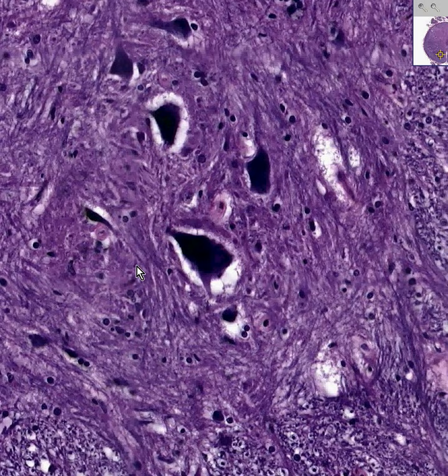Maybe if you see a real small one like there or there, that could very easily be a microglial cell. And a good rule of thumb is that not only are neurons 10 times bigger than astrocytes, but they're about 1/10 as common as well. And another rule of thumb is that if you could actually see the nucleolus of the nucleus of a neuron, it'd be about the size of a whole nucleus of a glial cell.